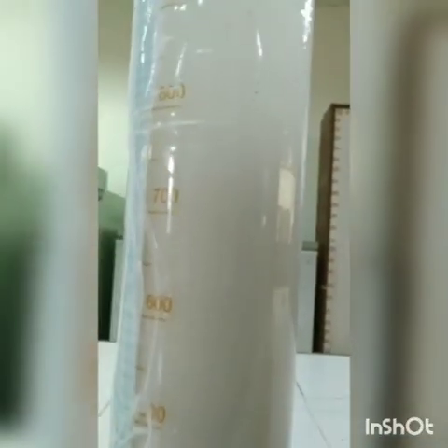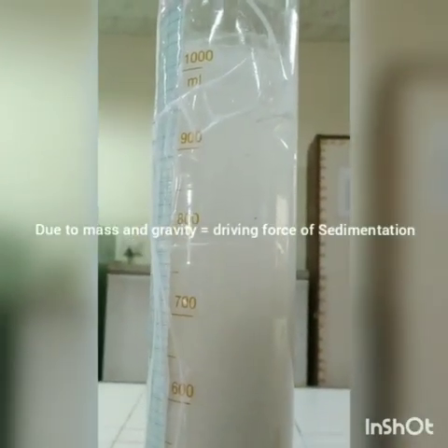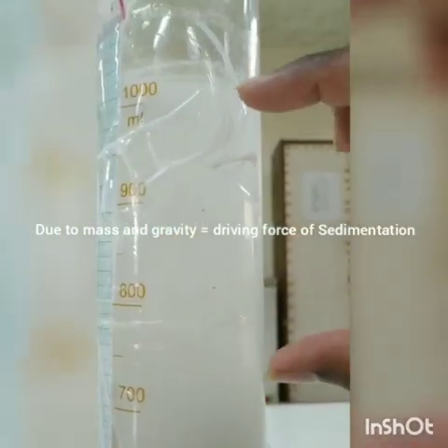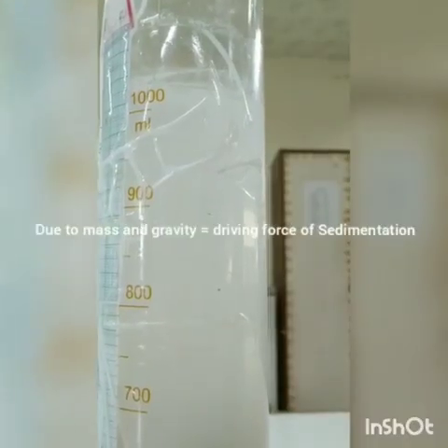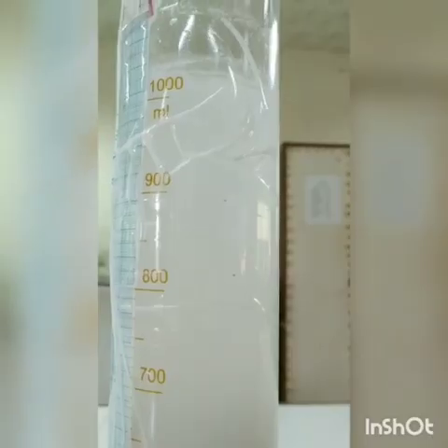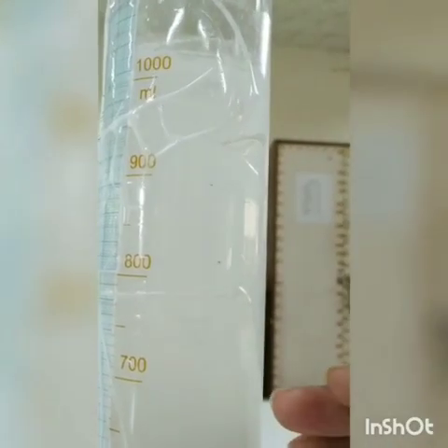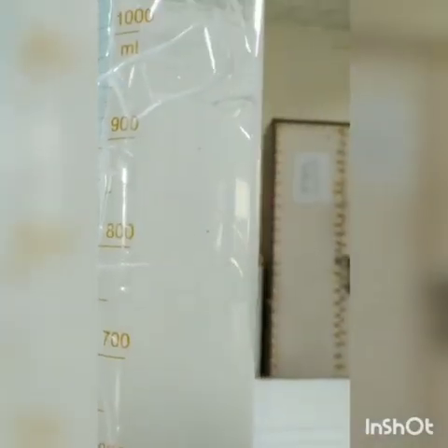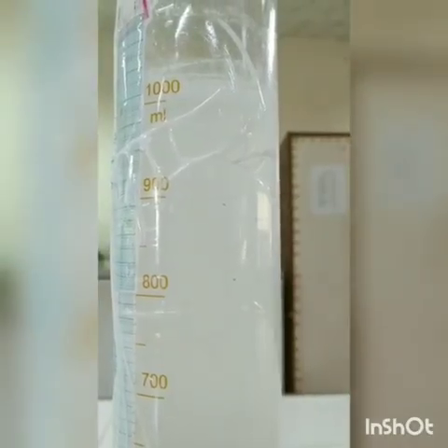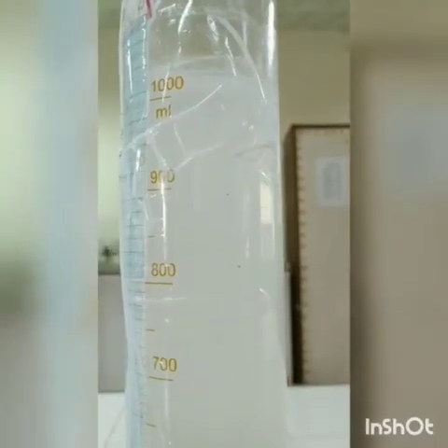The sedimentation is happening due to gravity, because the particle has mass. Due to the density, it is settling now. Can you see the clarified liquid? Now we need to measure the time taken for the clarified liquid. Now it is at 700. Slowly we need to measure the time interval until the particles settle at the bottom and the water becomes clear. We need to estimate the time taken, and from that we estimate the sedimentation velocity.